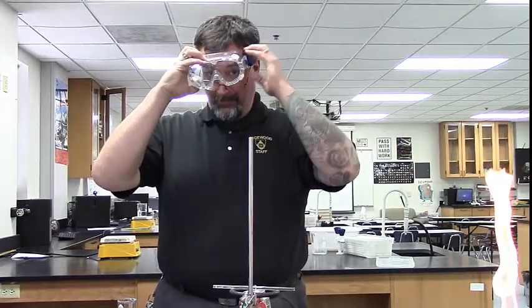So for the lab that you're going to be doing — a lab on food energy — I'm going to run through the basic setup and technique, and you'll be able to hopefully duplicate this when you come into lab. Don't forget, most important thing: wear your safety goggles.